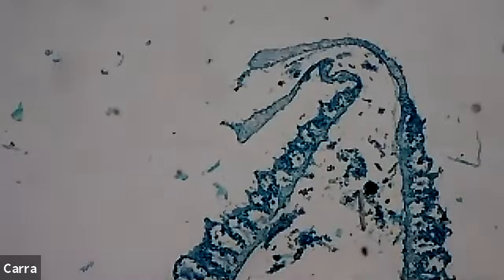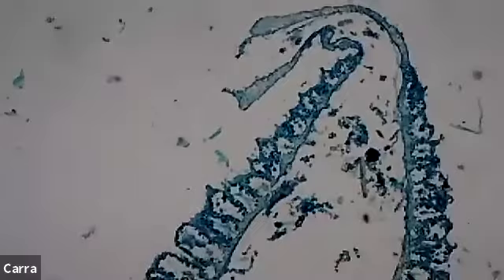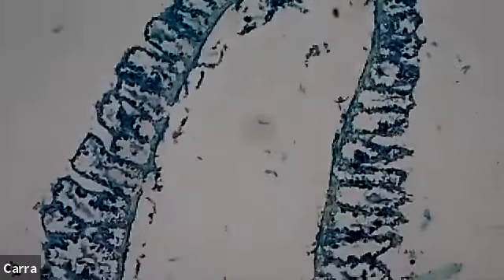So I'm going to go back through, and I want you to take one more really good look at how this sponge looks, how the fibers look, and how can you tell that this is a sponge if this was, say, a lab practical. Like I said, to me, it looks like popcorn fluff, and it's got those zigzags on either side, but otherwise it's pretty disinteresting, all right? And that's just my opinion. That's how I remember it.